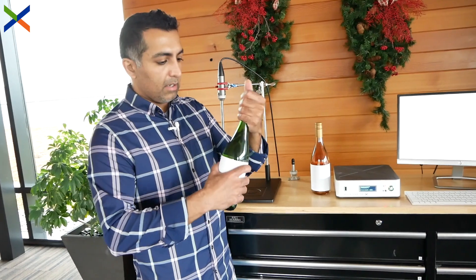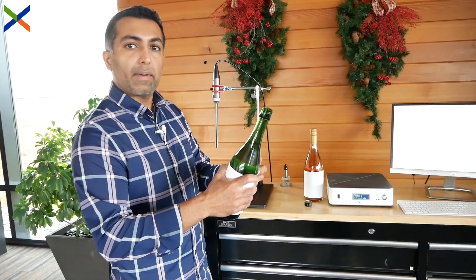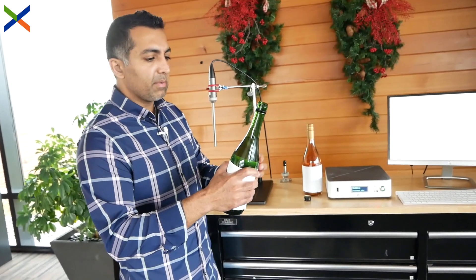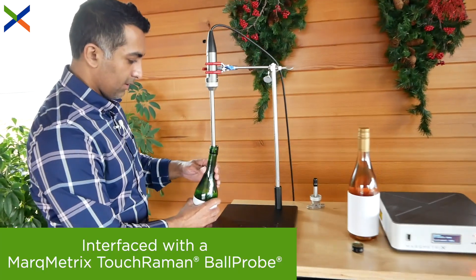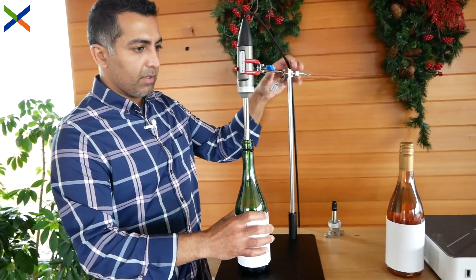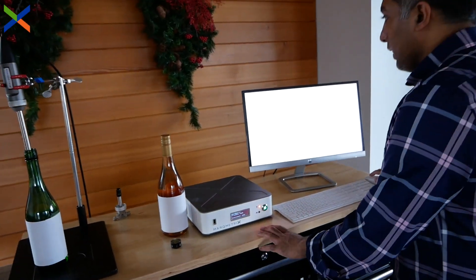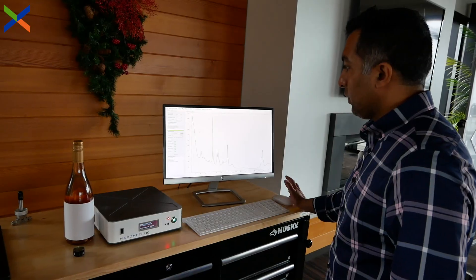This is the Japanese rice wine. I'd expect the sake to have about the same alcohol content as what we saw in the Riesling, but a little drier, so we might not see as many peaks coming from the sugars. We insert the ball probe directly into the bottle of wine, make contact with the wine, and in about two and a half seconds of data collection we see the Raman spectrum.